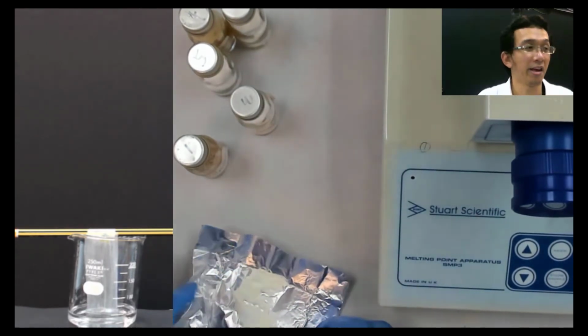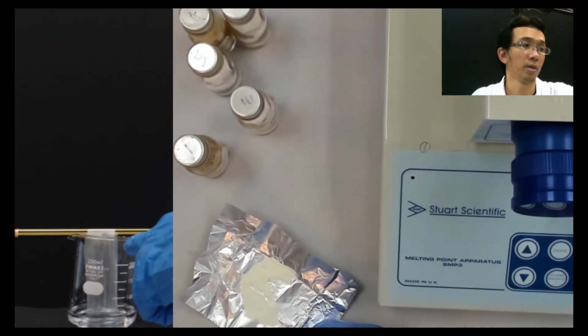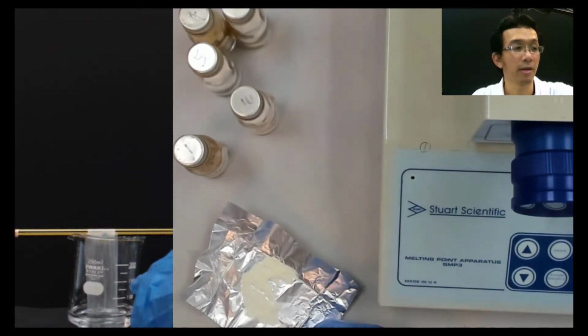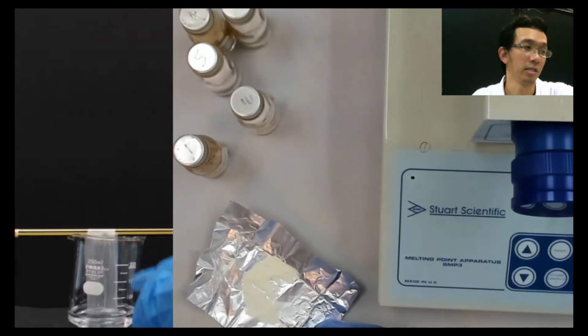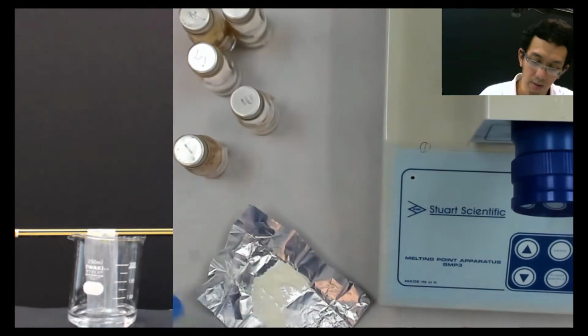If you think about it, TLC is just like that. Just put something on the TLC plate. This is a tissue paper, and then you put some solvent and done. So that's TLC actually.